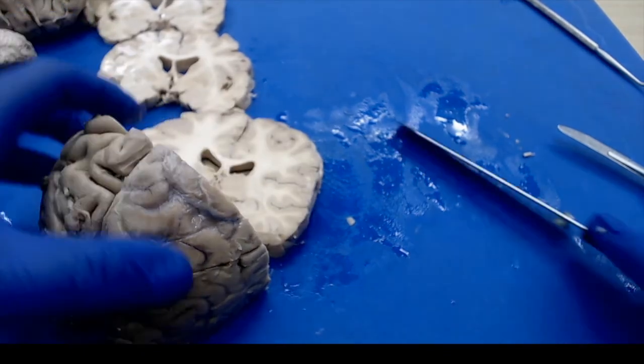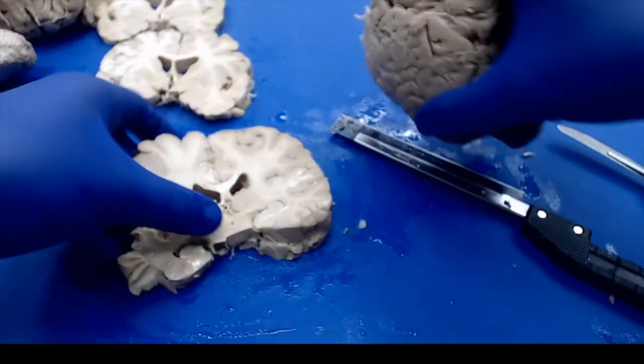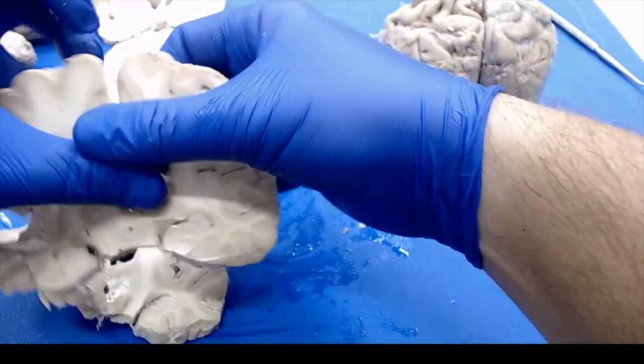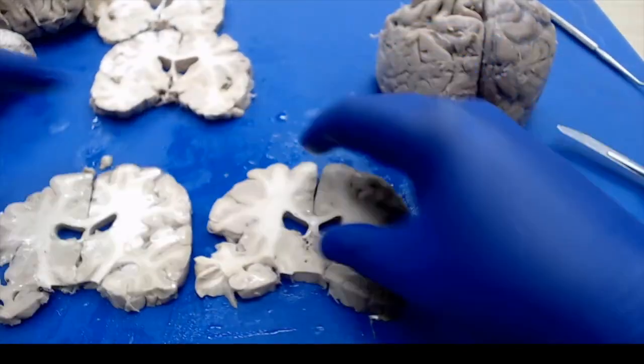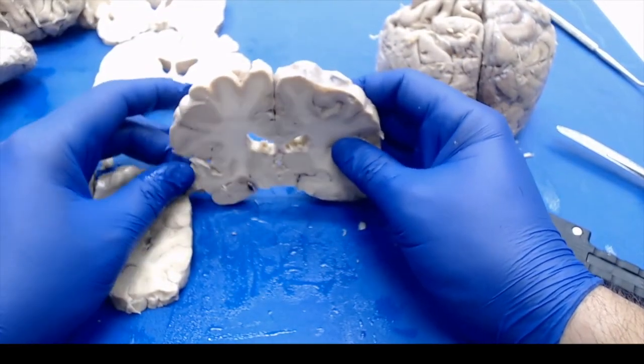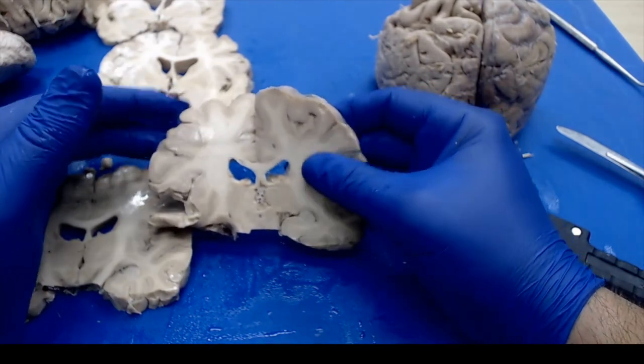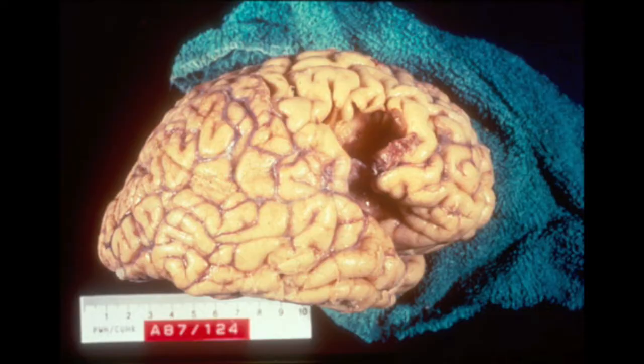You're going to look for infarcts, you're going to look for any sort of lesions, necrotic tissue, and as you learned in path, the type of necrosis that brains undergo is called liquefactive necrosis. We don't have the same connective tissue components that we see in the rest of the body, so when parts of the brain end up dying off, they just become liquefied and get reabsorbed, so you'd actually see cavitated areas in the brain. Now I'm going to go ahead and get the rest of my sections here.